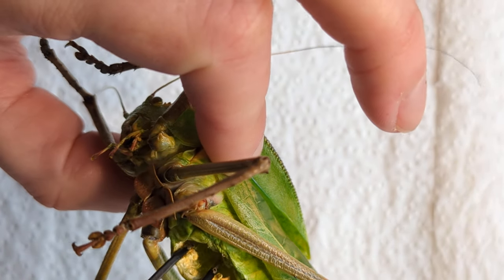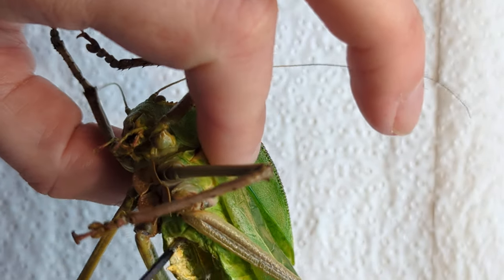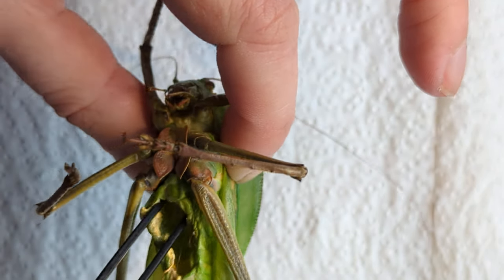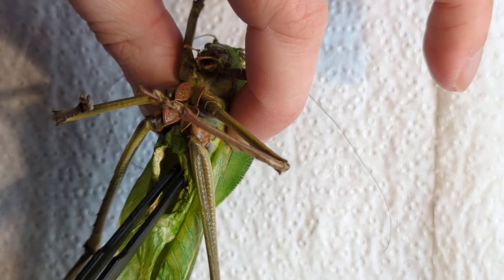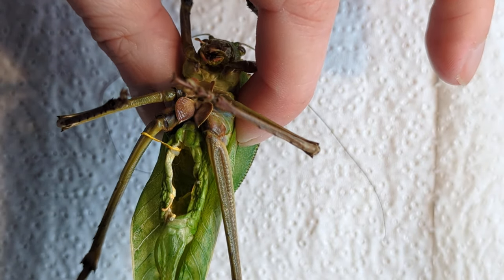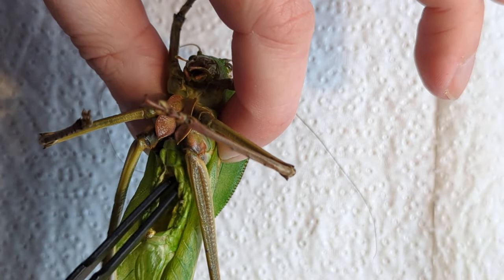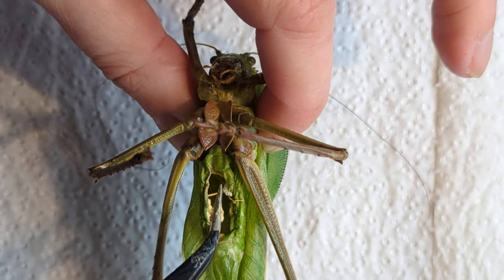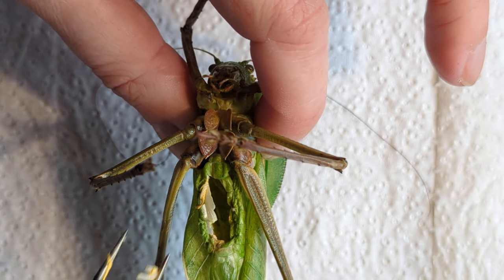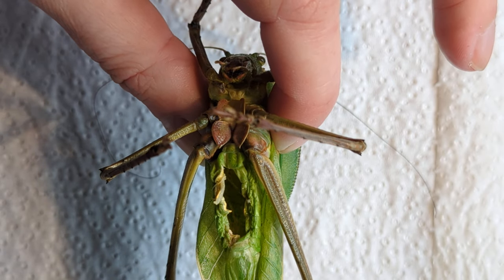Just going to take out this inner membrane, then we're going to clean them out. I do actually quite enjoy the evisceration process. I think this is a rewarding part of the process — there's that extra step of cleaning something. Maybe it's because I don't do it very often that I find it quite interesting.